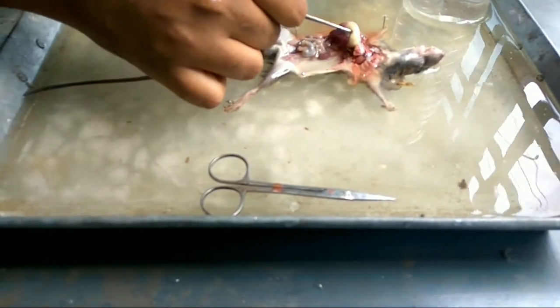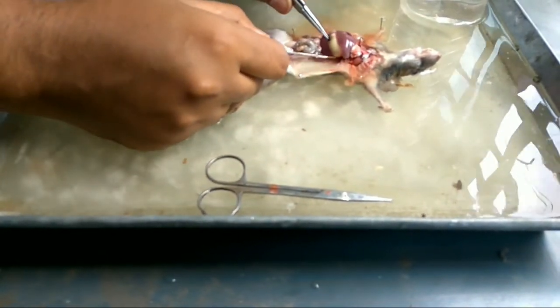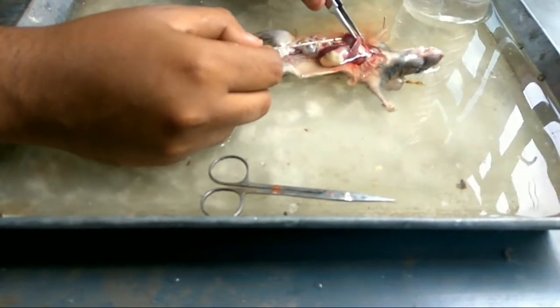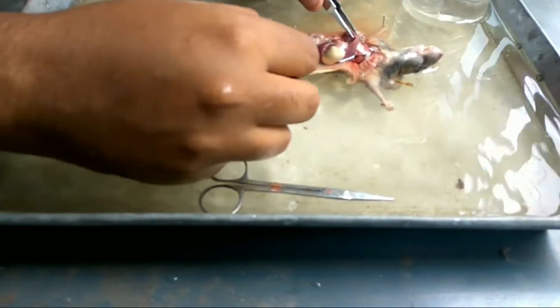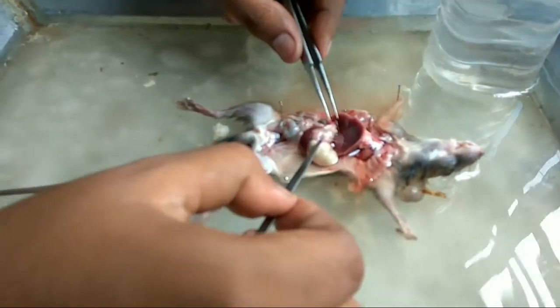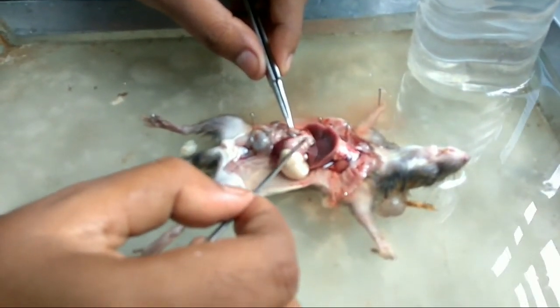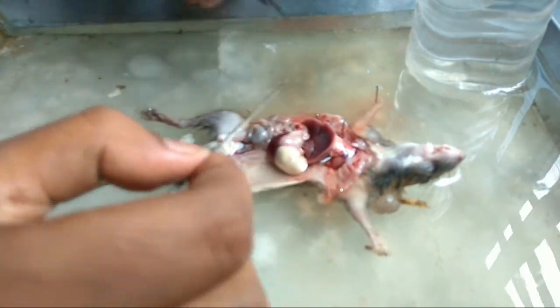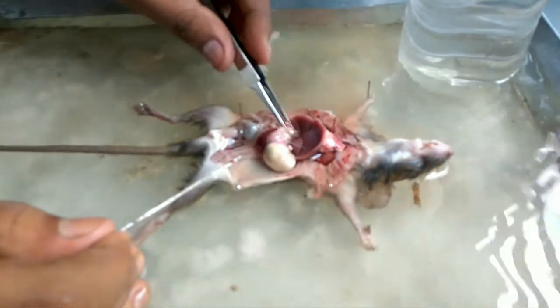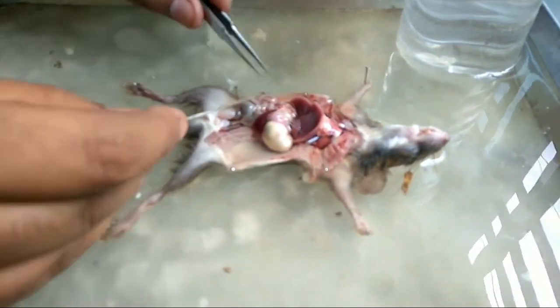The stomach is the yellowish one — it is large and J-shaped, white or light yellow in color. Just below the stomach you can find the C-shaped duodenum. Within the C-fold of the duodenum you can find the pancreas, which is just a leaf-like structure.